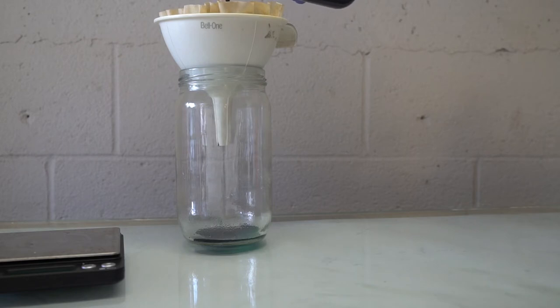Now this will take a long time to dry. I spread the coffee filter out over paper towels and let it sit for a few days in a dry environment.